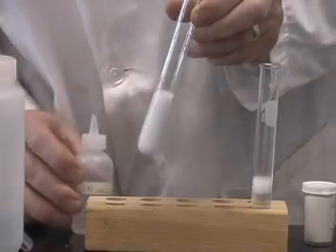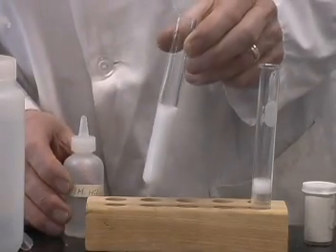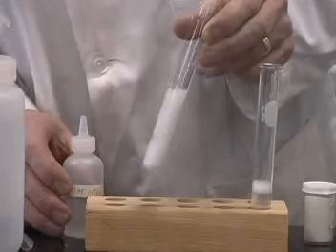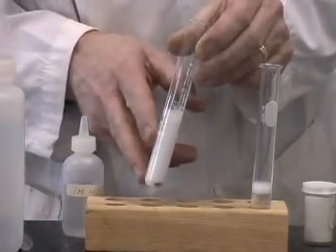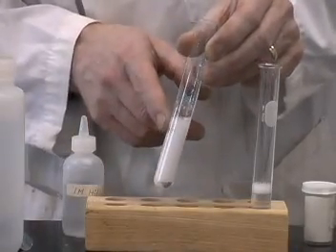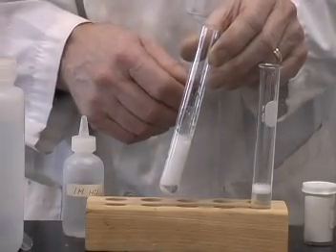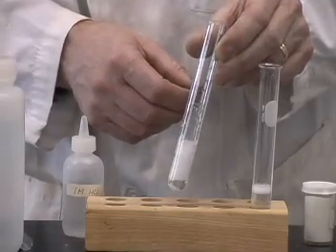And you can see that again, we're generating lots of gas as the hydrochloric acid and the sodium carbonate react together to form carbon dioxide gas. In fact, I can take any carbonate compound and react that with an acid, and we get carbon dioxide gas being generated. This is, in fact, a test that we often use for the presence of carbonate in rocks, for example, such as limestone.